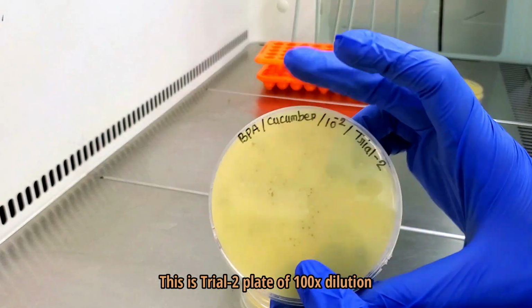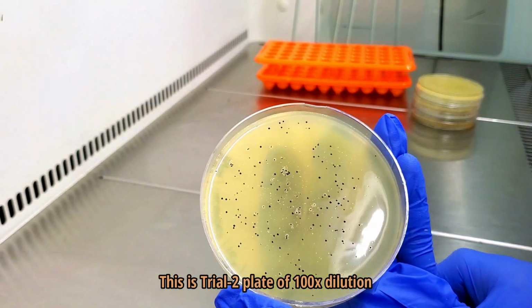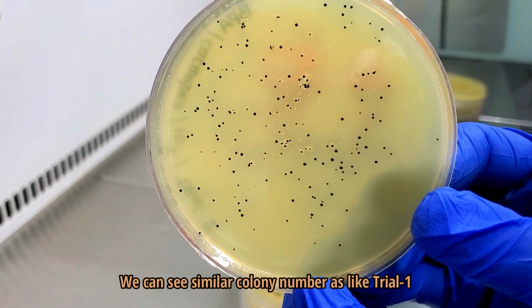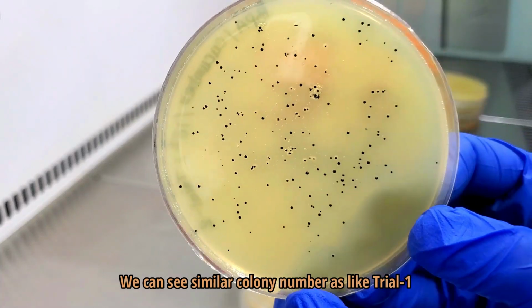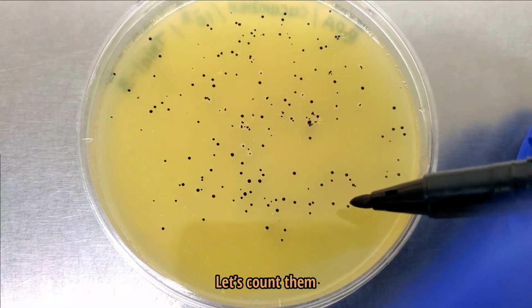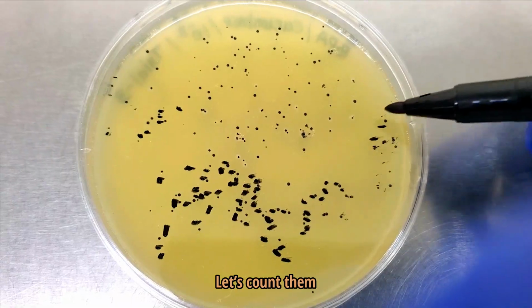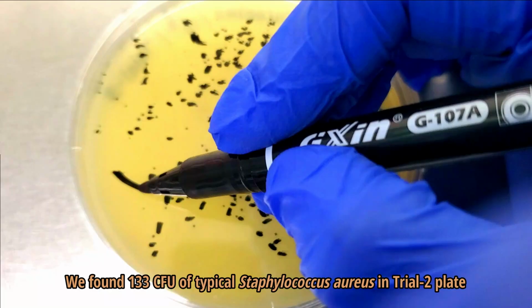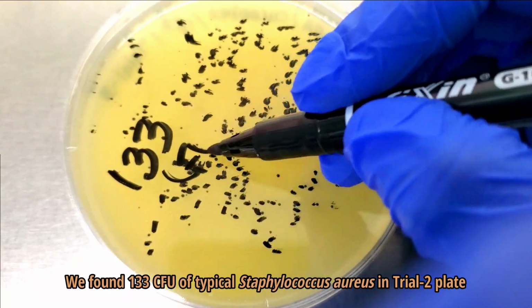This is trial 2 plate of 100 times dilution. We can see similar colony number as like trial 1. Let's count them. We found 133 colony-forming unit of typical Staphylococcus aureus in second trial plate.